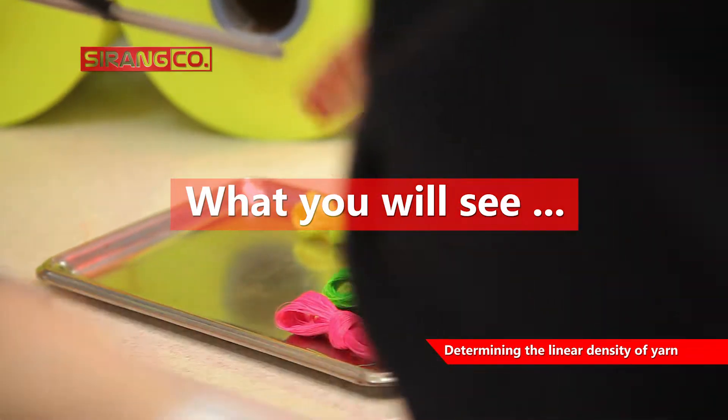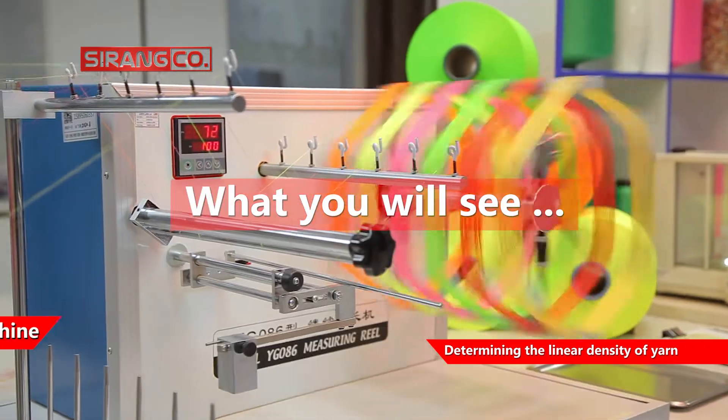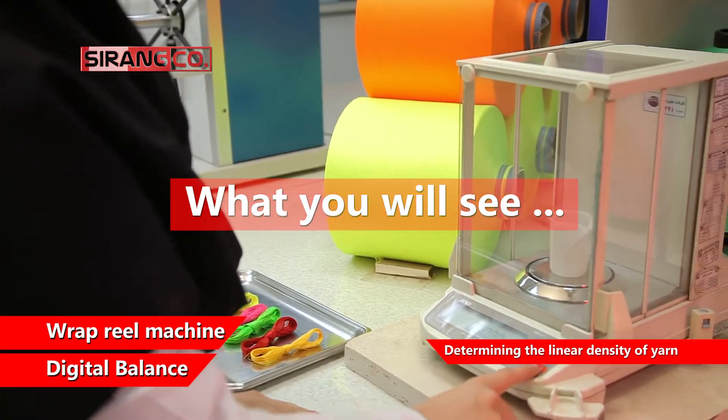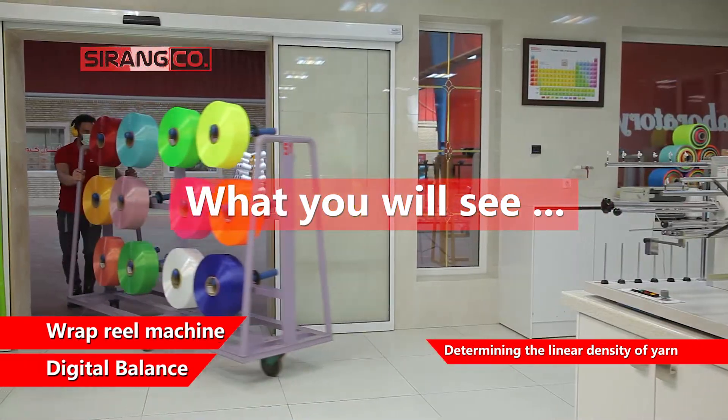The devices used to determine the linear density of yarn include a wrap reel machine and a digital balance with a sensitivity of 1 mg.